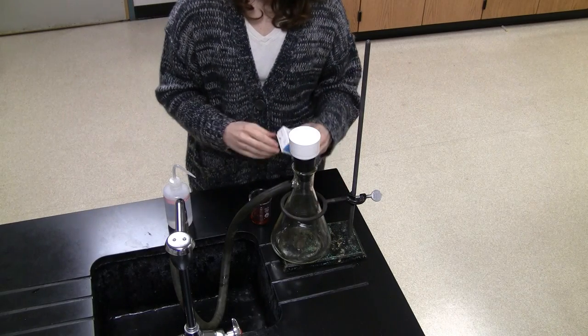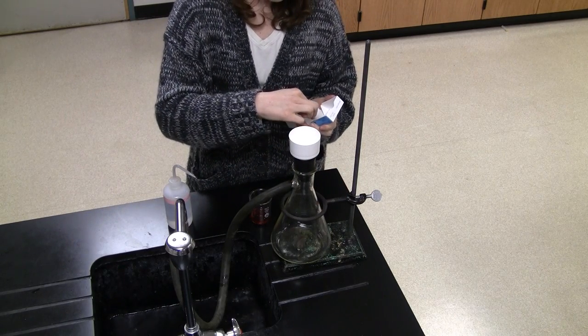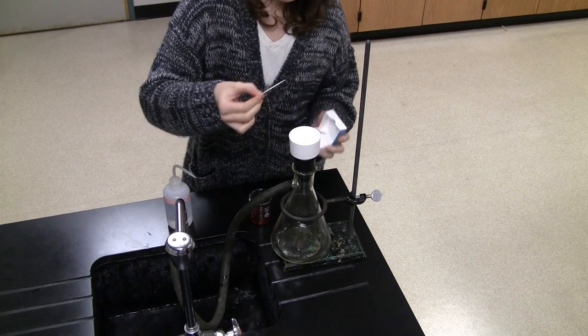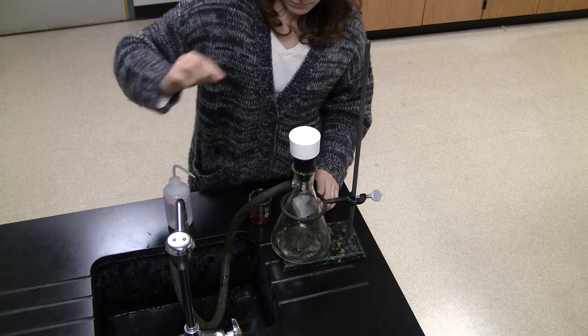Handling a piece of filter paper by its edges, place the filter paper in the Buchner funnel, making sure to cover all of the holes.